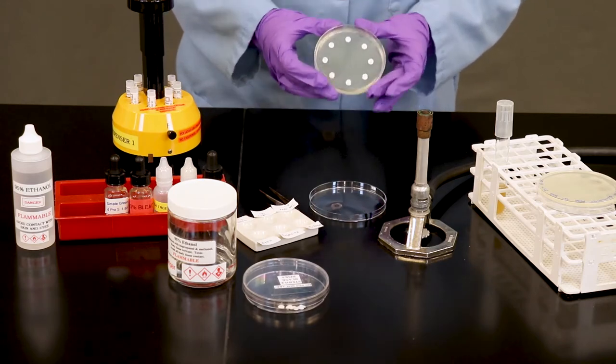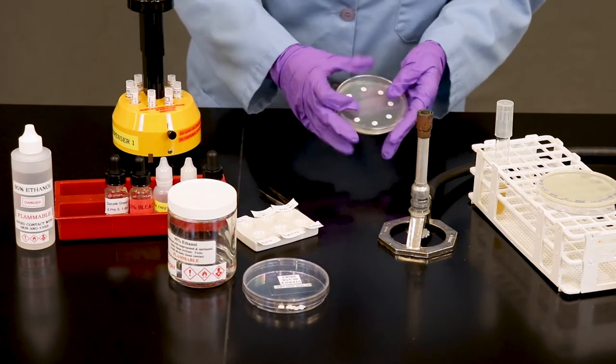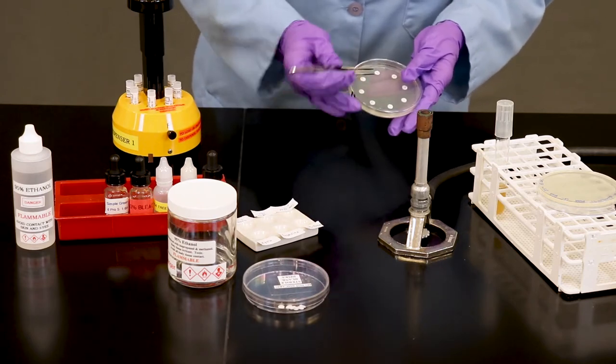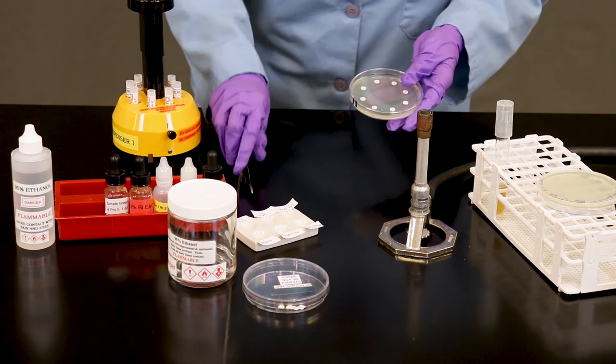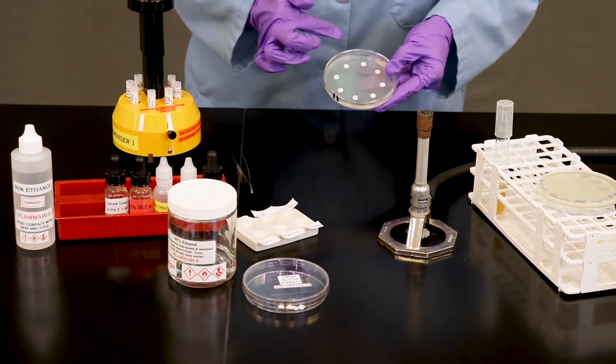Ideally, they should not be dug into the agar. In some cases, your instructor can help you place them appropriately down if they don't lay flat. Each of these discs is labeled with an initial indicating the type of antibiotic.